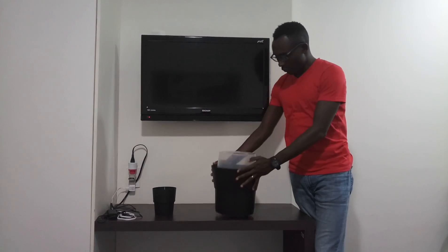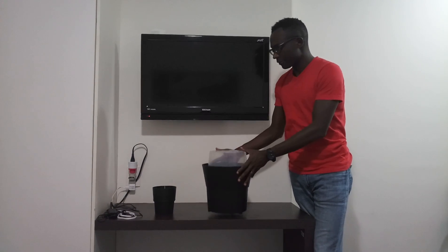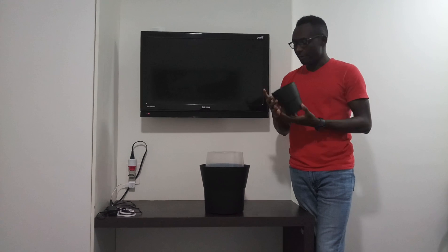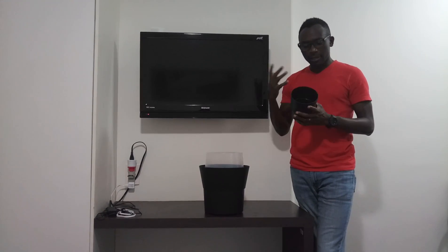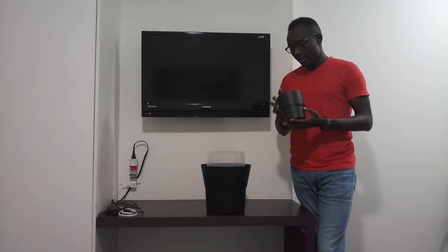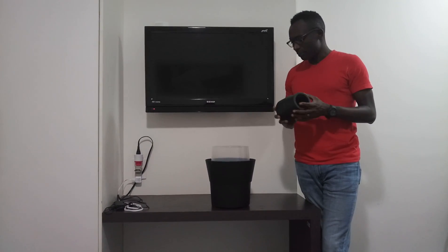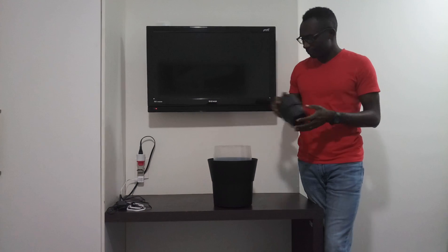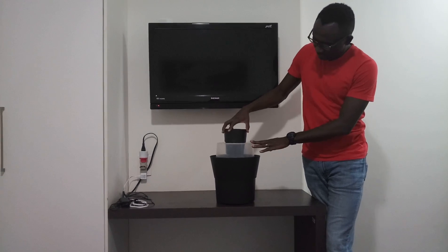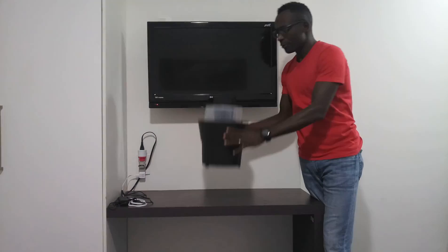Put that right in there — it fits very well. Then you have the black funnel. This black funnel also forms a visual cue for oviposition-site-seeking Aedes aegypti mosquitoes, and of course you can also use this for other Aedes species. Put that right there — as you can see it fits tightly. Once that's fitted, you are ready to go.